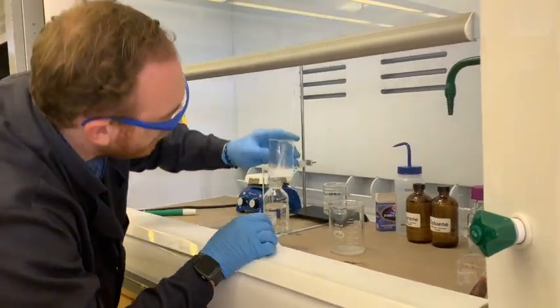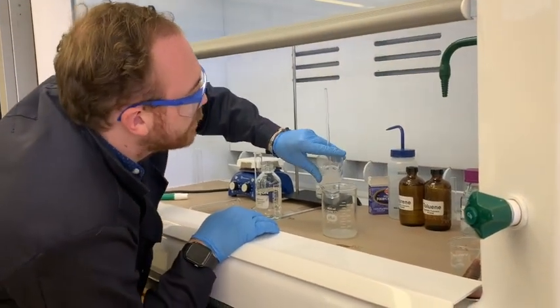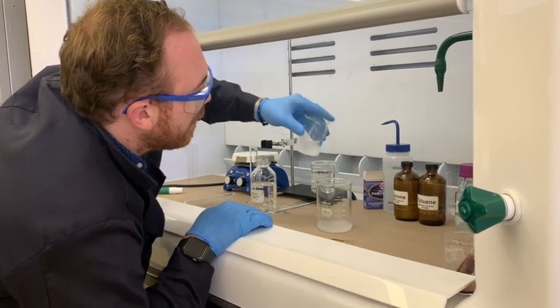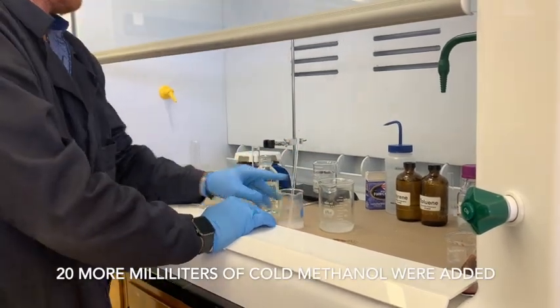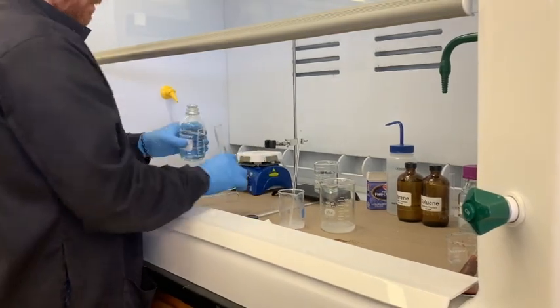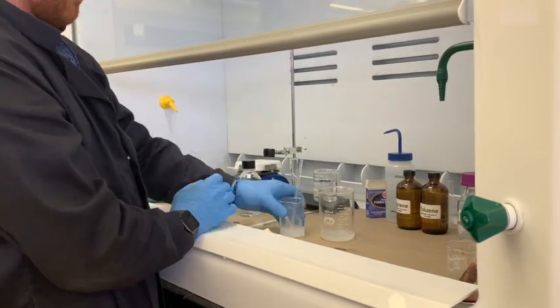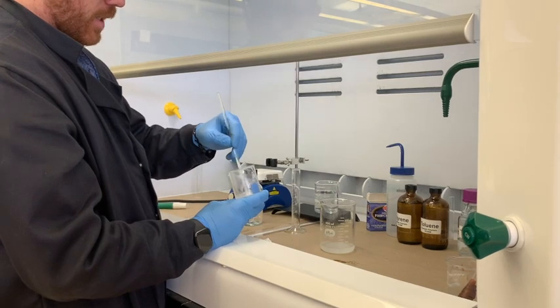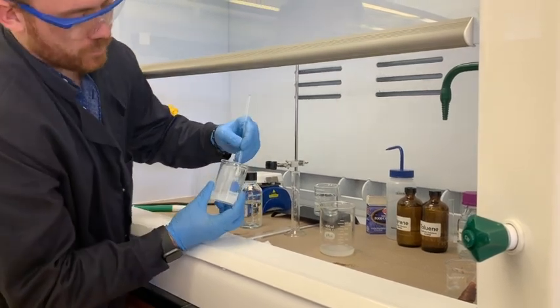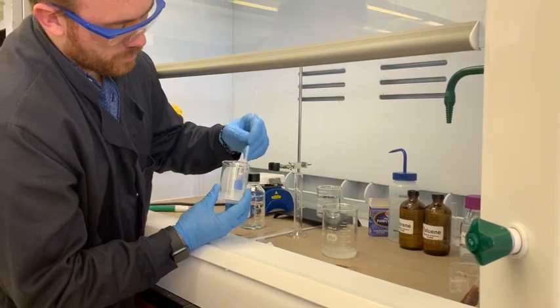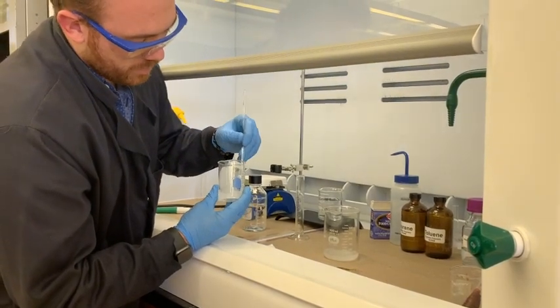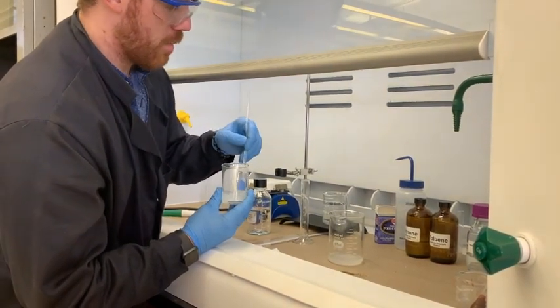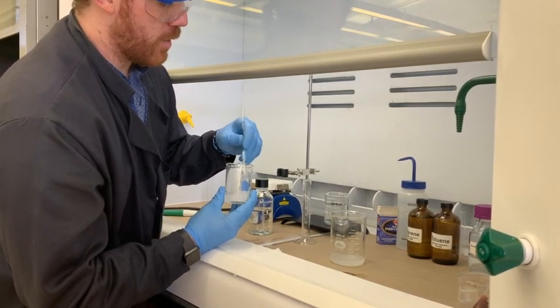Alright. So I'm going to carefully decant off some of the top solution. Add a little bit more of the methanol. Let's say another 20 milliliters. By adding extra methanol, we are pushing this polystyrene further and further out of solution. Bring it to precipitate. And changing how soluble it is in solution.